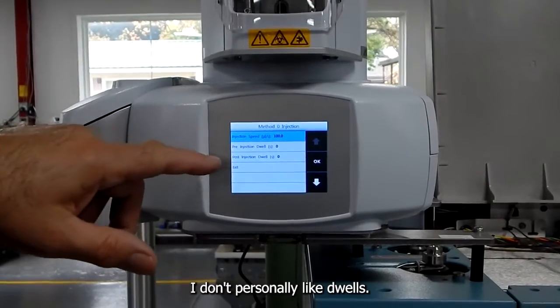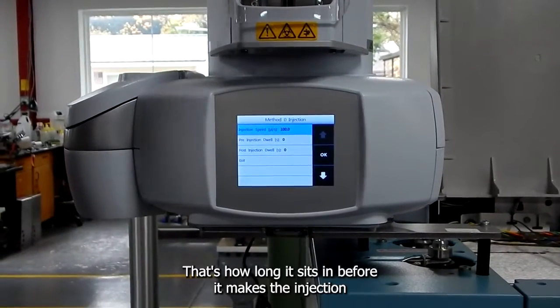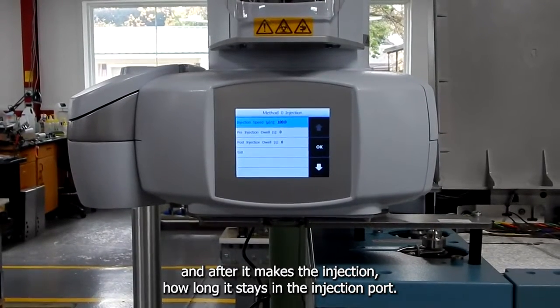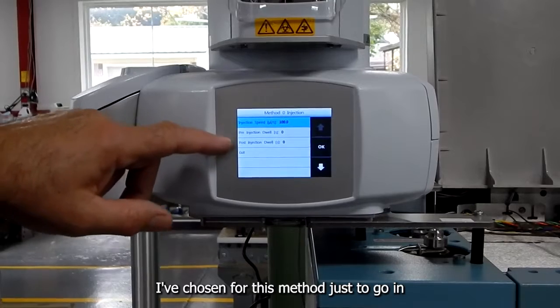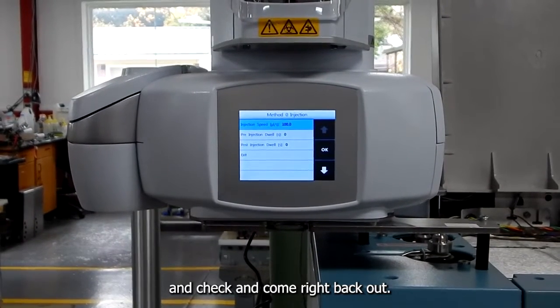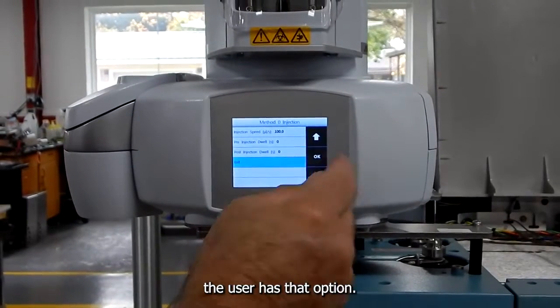I don't personally like dwells. That's how long it sits in before it makes the injection, and after it makes the injection, how long it stays in the injection port. I've chosen for this method just to go in, inject, and come right back out. But again, the user has that option.